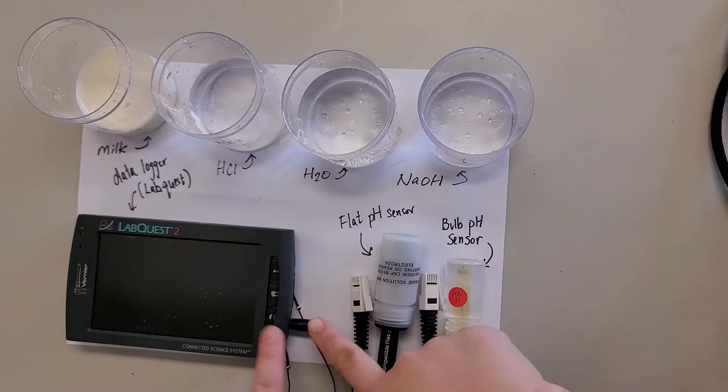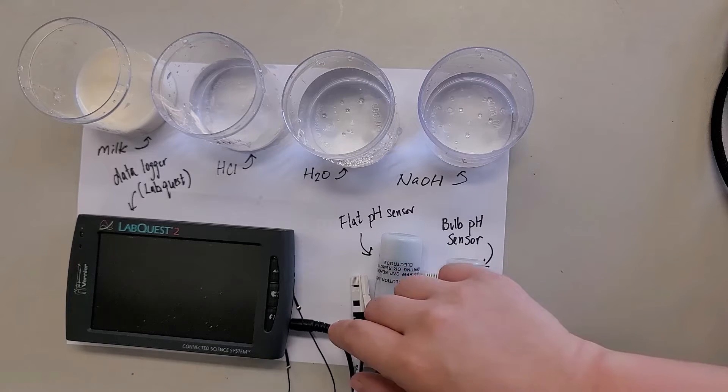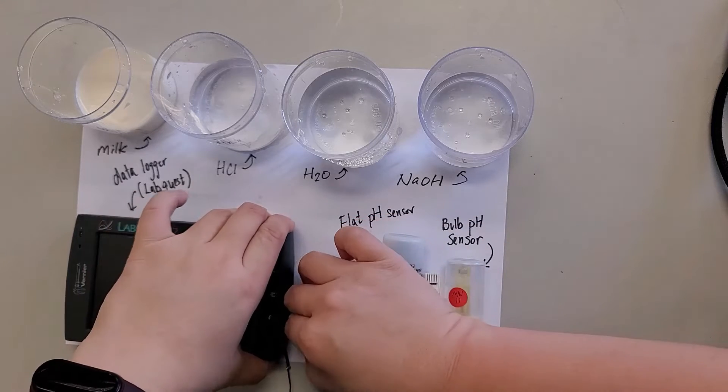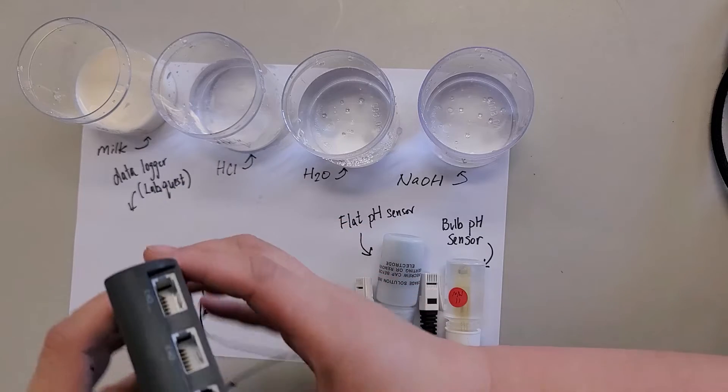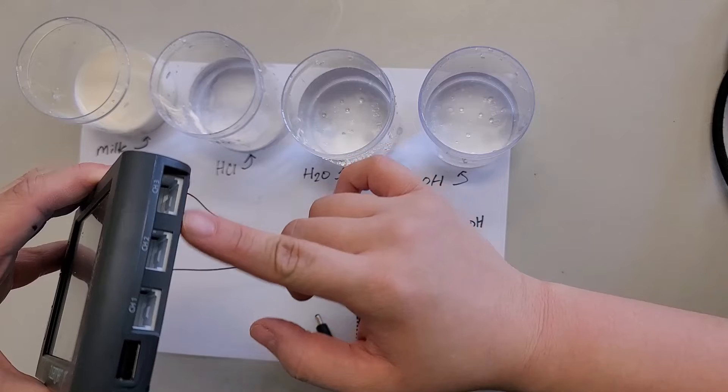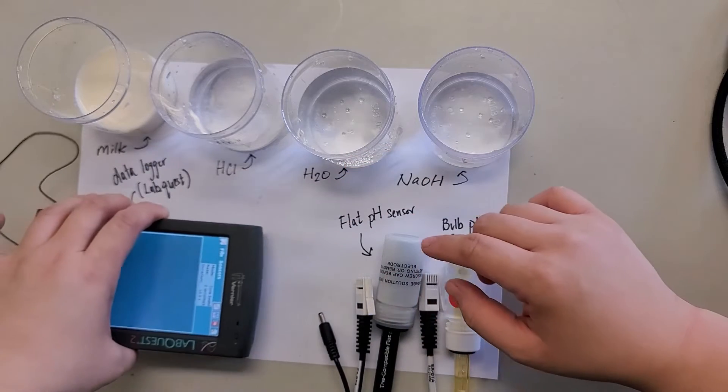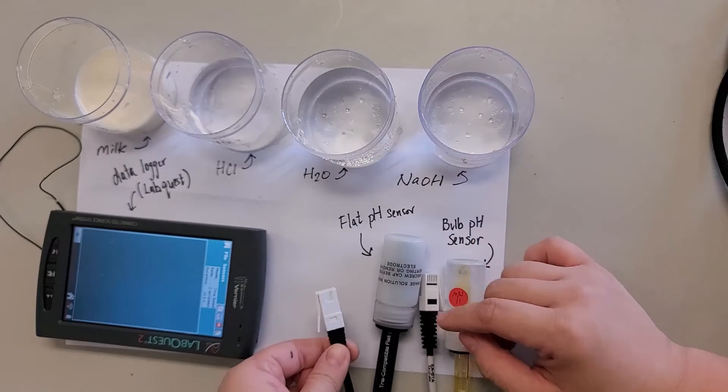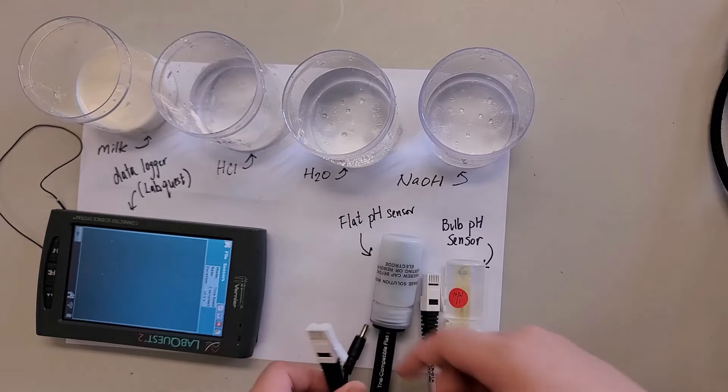Basically, they connect it to the sensor directly. Let me just take it out. You can see here, there are some channels. It's kind of like the phone jacks. You can see that the ending looks a bit like this as well.